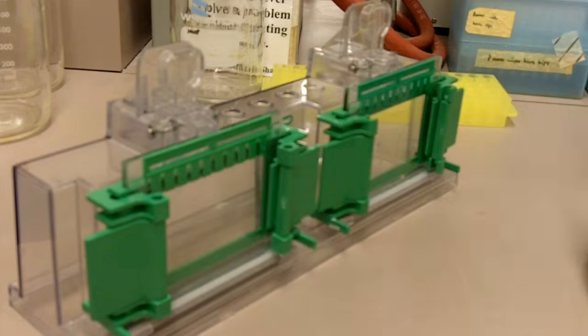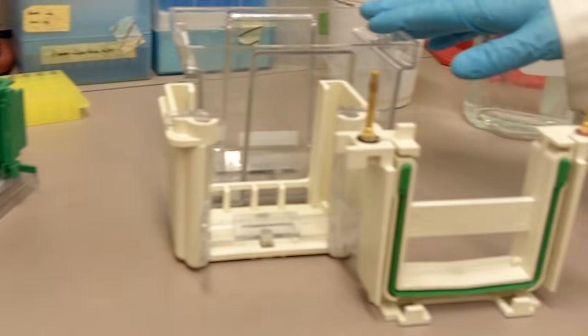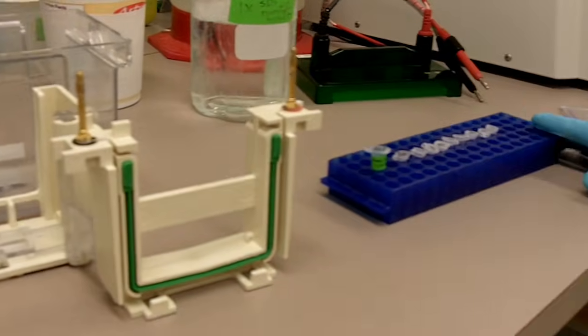Before you run your gel, make sure you have your gel ready, your gel apparatus ready, and your samples ready.